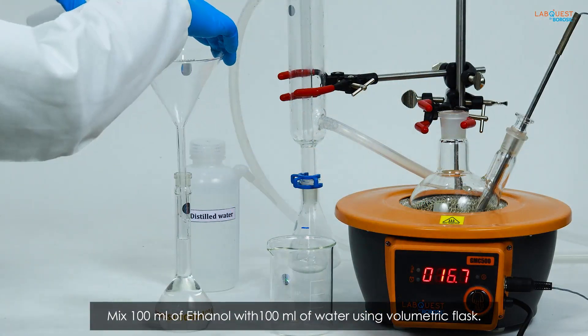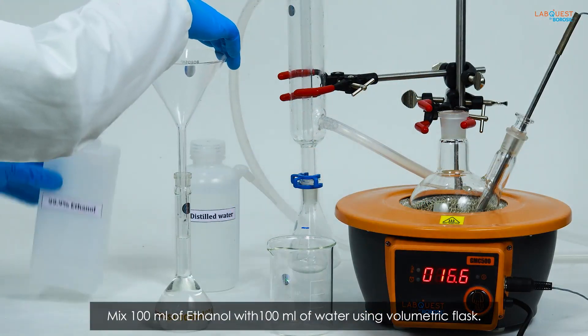Mix 100 ml of ethanol with 100 ml of water using volumetric flask.